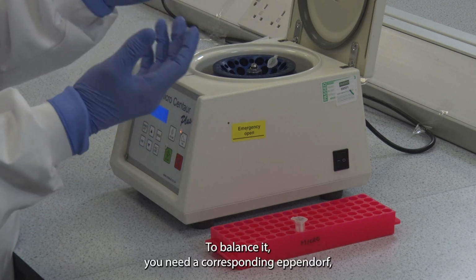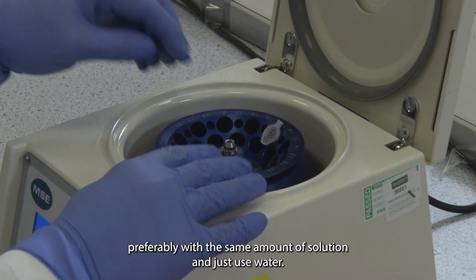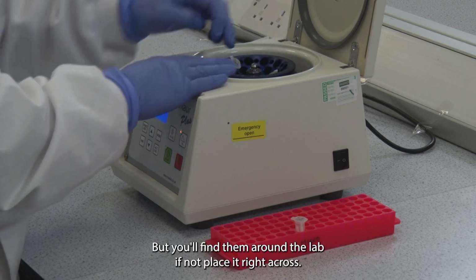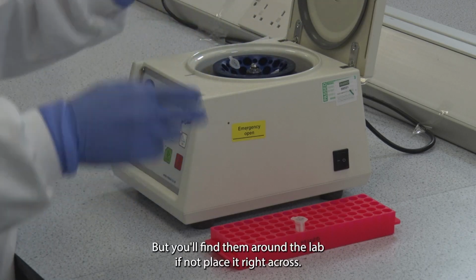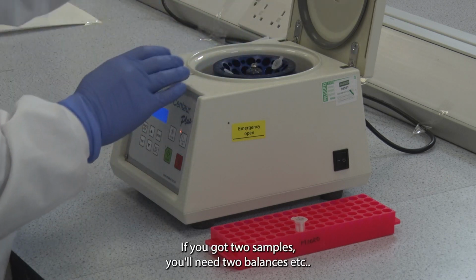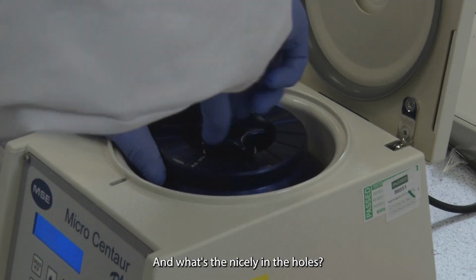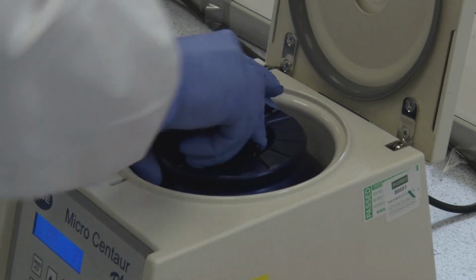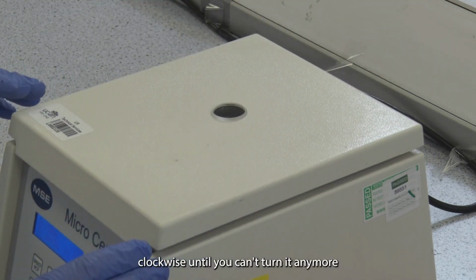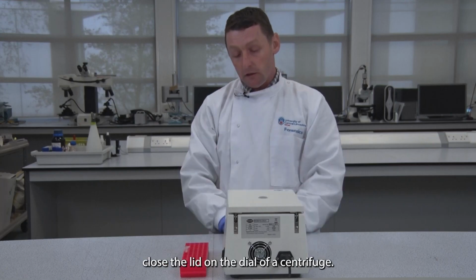To balance it, you need a corresponding Eppendorf, preferably with the same amount of solution, and just use water, but you'll find them around the lab if not. Place it right across, so balance it right across from each other. If you've got two samples, you'll need two balances, etc. And once they're nicely in the holes, get the rotor, turn it clockwise until you can't turn it anymore, and then using your hands just nicely close the lid.